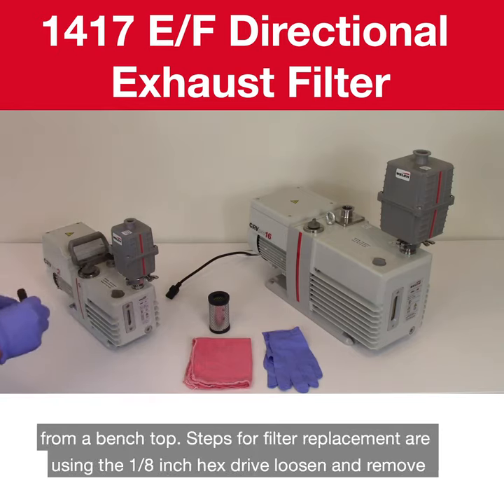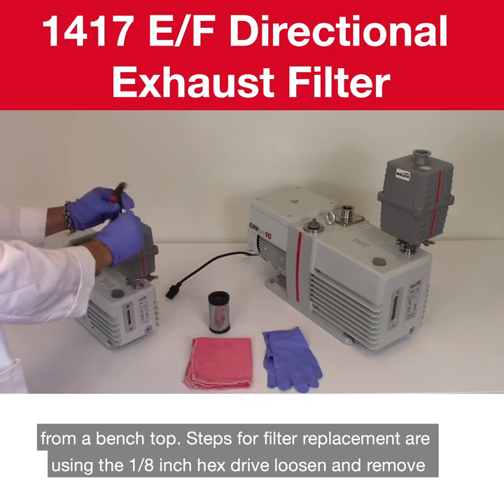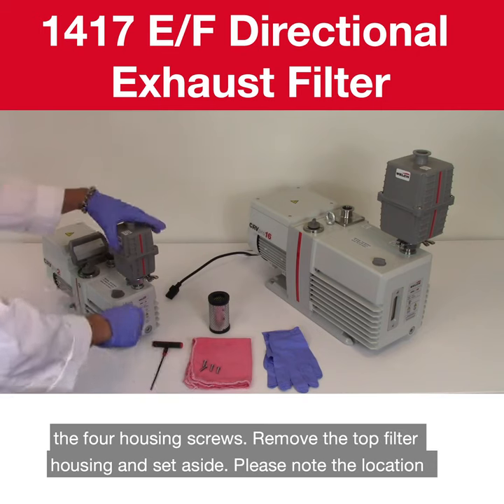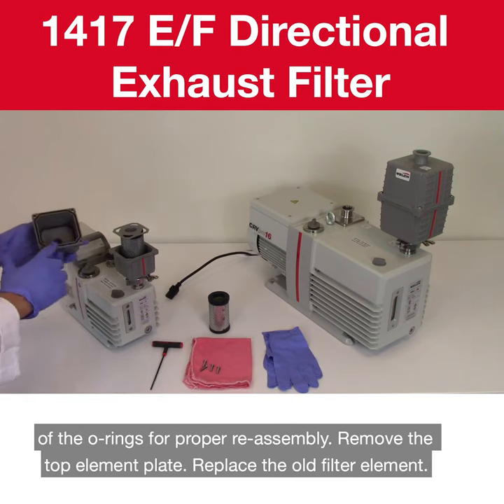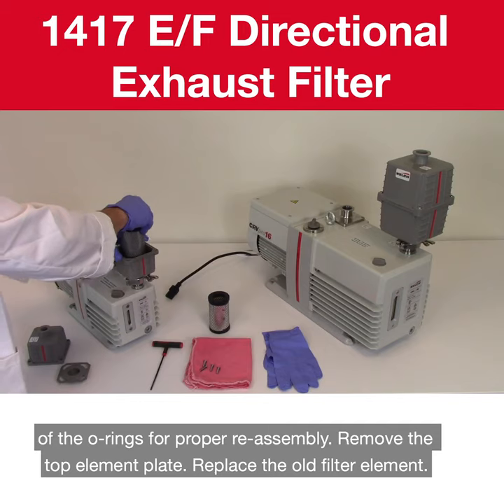Steps for filter replacement are: using the 1/8 inch hex drive, loosen and remove the 4 housing screws. Remove the top filter housing and set aside. Please note the location of the O-rings for proper assembly. Remove the top element plate. Replace the old filter element.